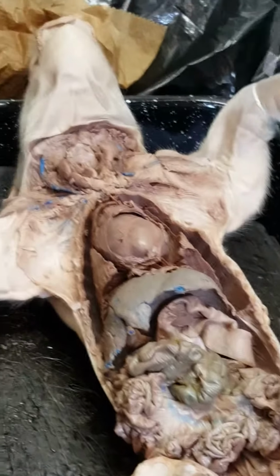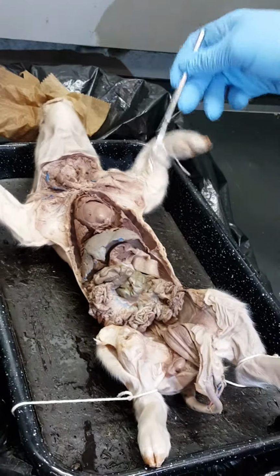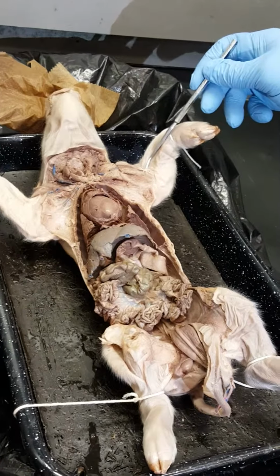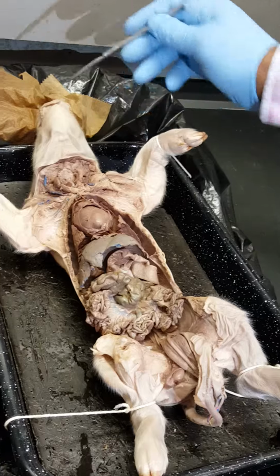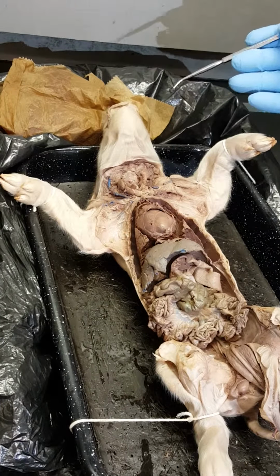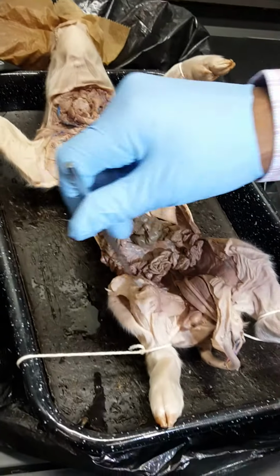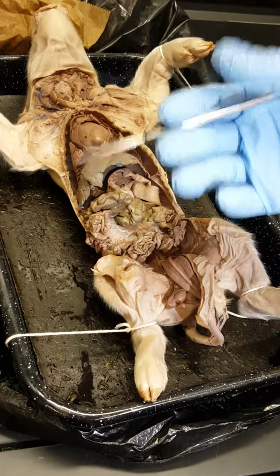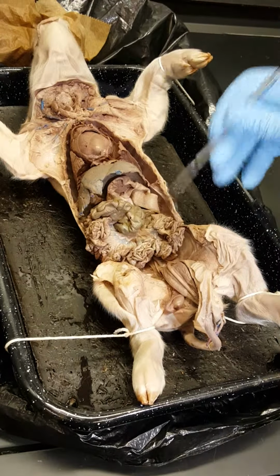Now, the cutaneous membrane is the skin; if you saw a pin in the skin, that's cutaneous. If you saw something up in the snout, that's mucous membranes. Something here would be the synovial, because of the joints. And that's pretty straightforward. Beautiful.